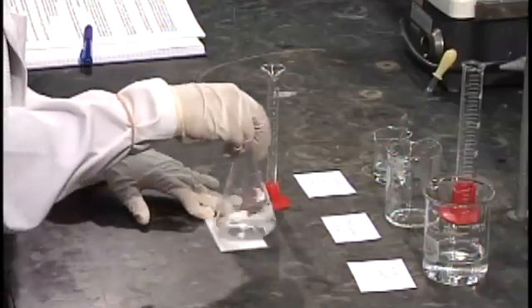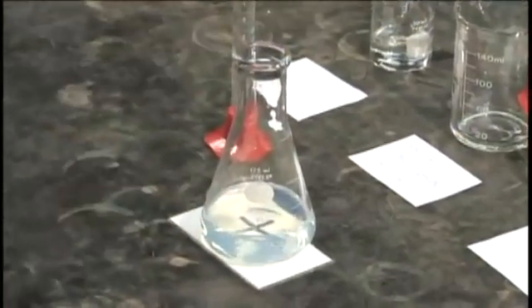We swirl the flask once or twice, then wait until we can no longer see the cross.